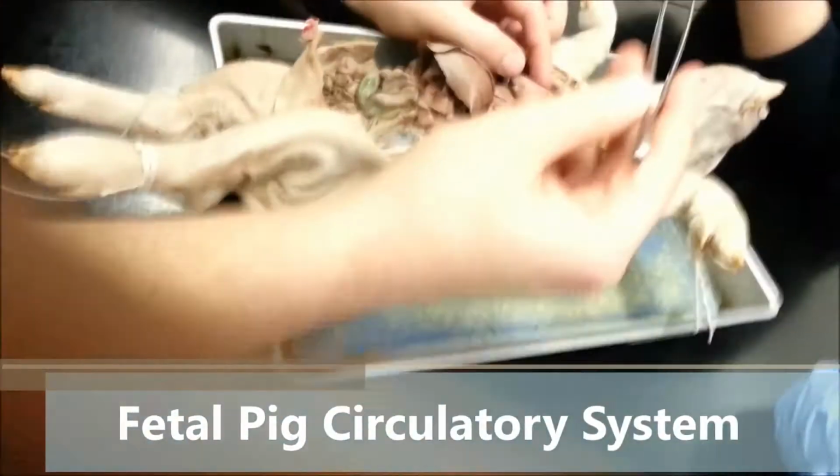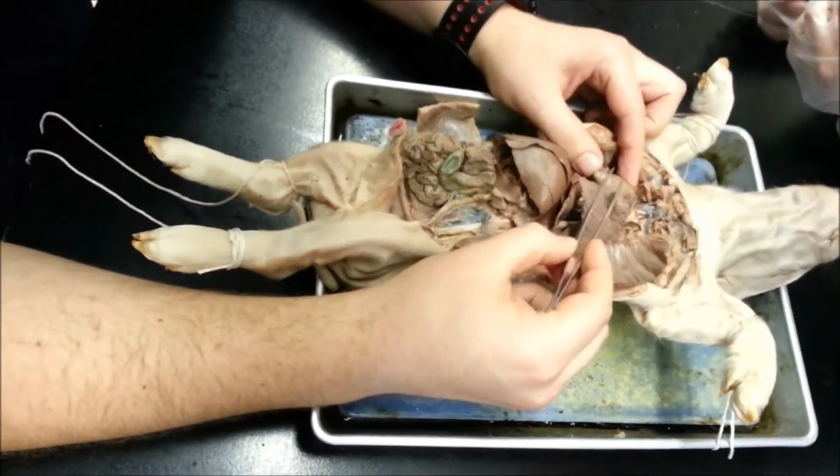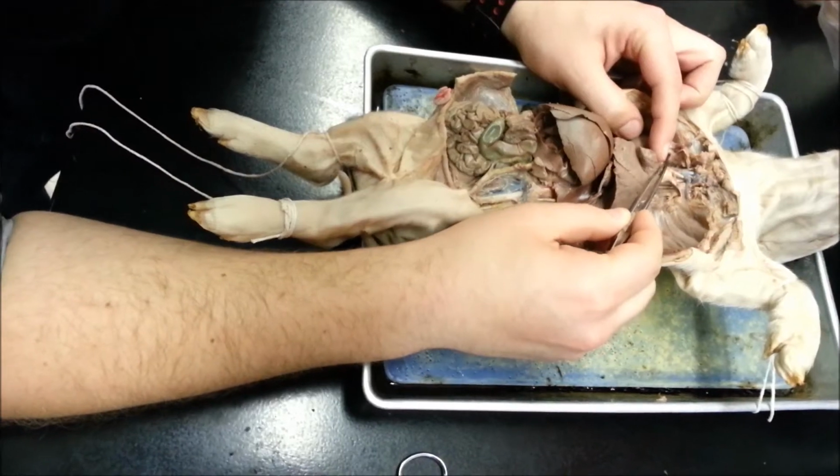Thoracic cavity. We have our heart. Right, we're continuing on from last class. We're doing the circulatory system. So, from the left ventricle, which is pointing here, when it pumps, it's going to pump into the aorta that we see here.